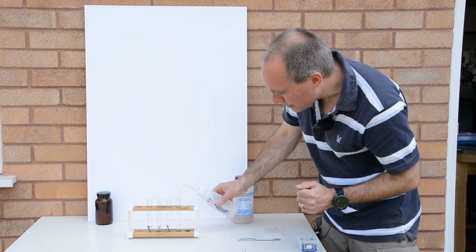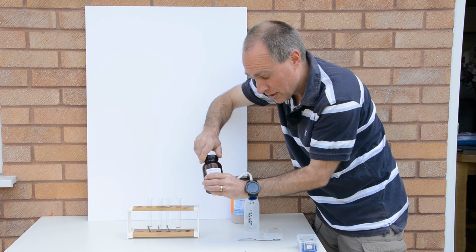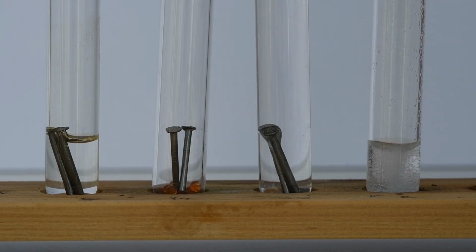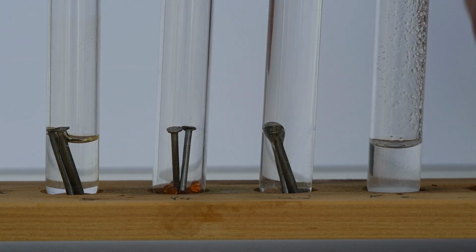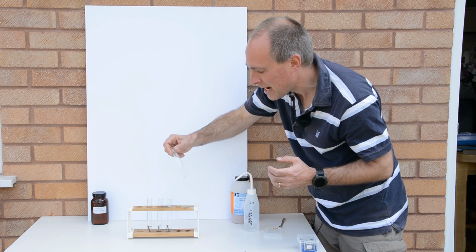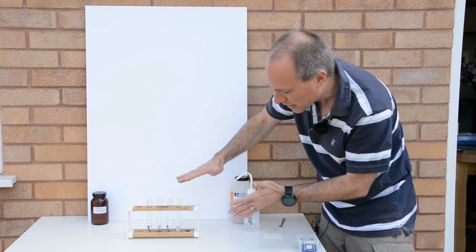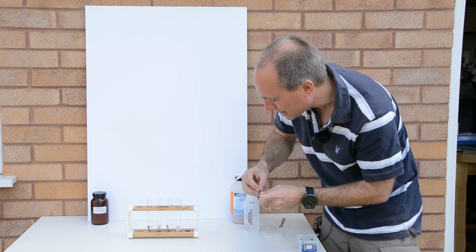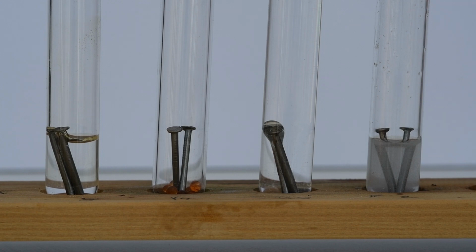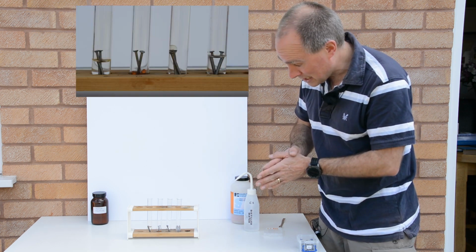And then finally, in the last tube, I'm just going to put some water, and to that water I'm going to add some salt, just normal table salt, sodium chloride, as if we were doing the experiment near the seaside. People who live near the sea often complain that their cars and anything else that's made with iron tends to rust much faster. So we'll put that to the test. So we've got some seawater, some sodium chloride and water in there. I'll just pop a couple of nails into that test tube. That salt will dissolve over a period of time, and we'll have a look and see what happens to the nails in that test tube.